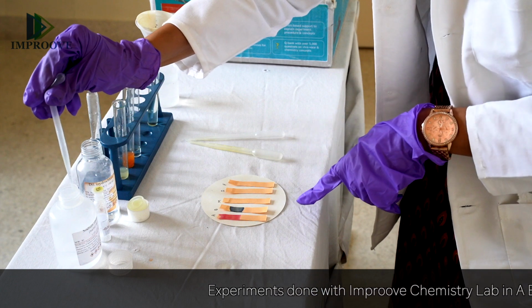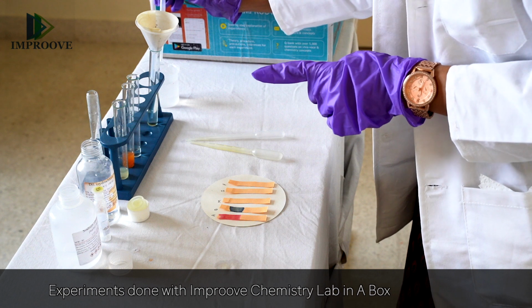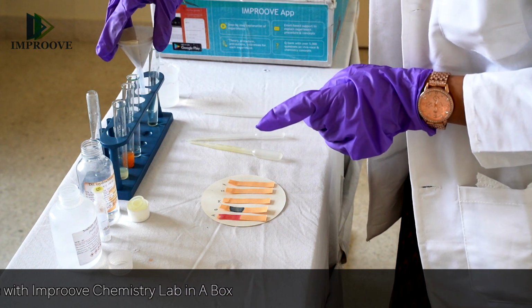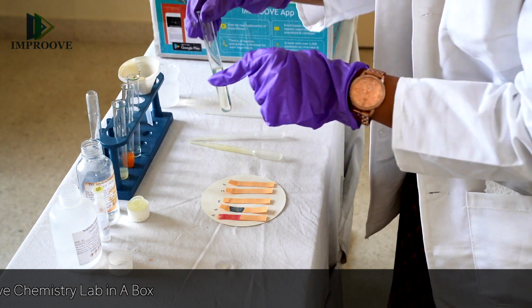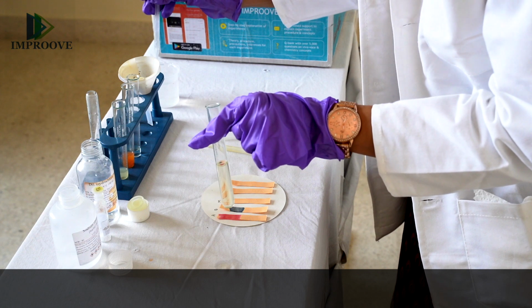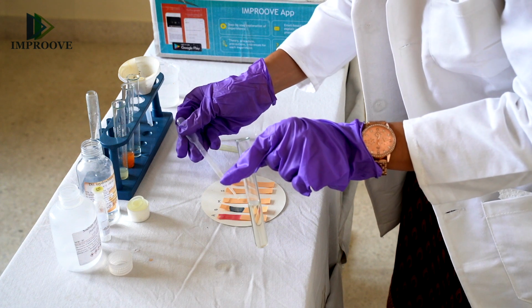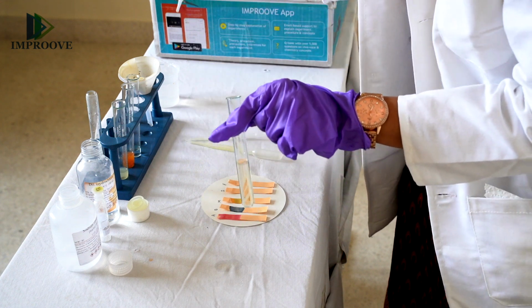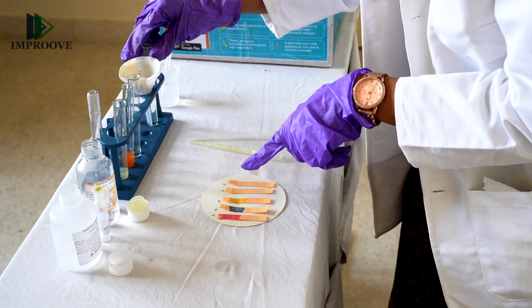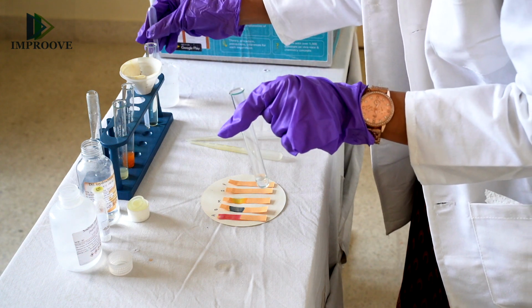The third one, I have labeled as M, which denotes the muddy solution. Notice if there's any color change. The fourth one I have labeled as S, which denotes the sodium chloride solution.